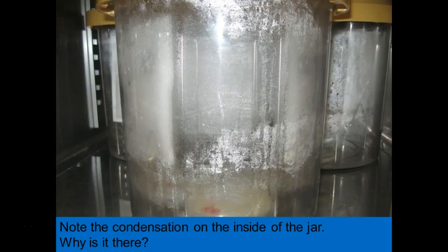That's one of my jars. What do you see here? Condensation, because what's forming? Water. So I know, again, it's working, right? And if I looked at my tablet, hopefully once the condensation clears, it should be white or colorless.